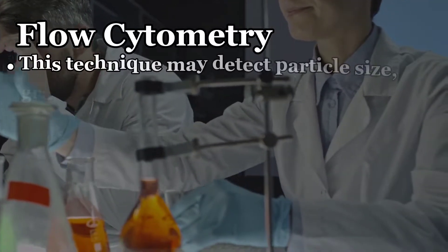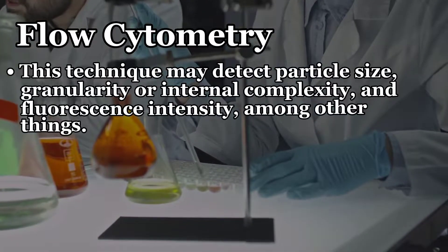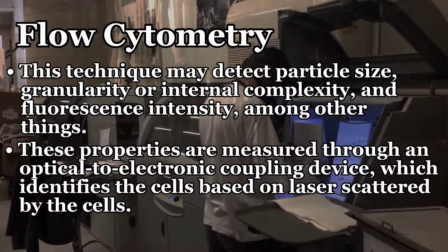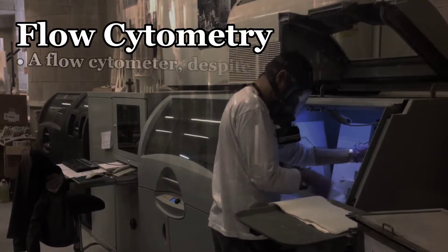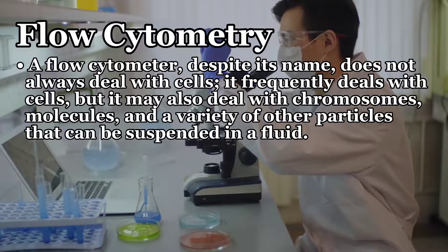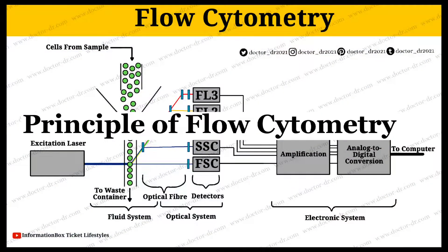This technique may detect particle size, granularity or internal complexity, and fluorescence intensity, among other things. These properties are measured through an optical-to-electronic coupling device which identifies the cells based on laser scattered by the cells. Flow cytometry, despite its name, does not always deal with cells — it frequently deals with cells but may also deal with chromosomes, molecules, and a variety of other particles that can be suspended in a fluid.